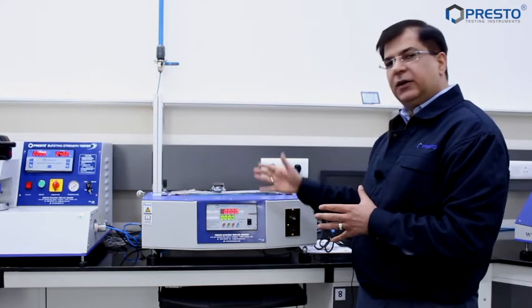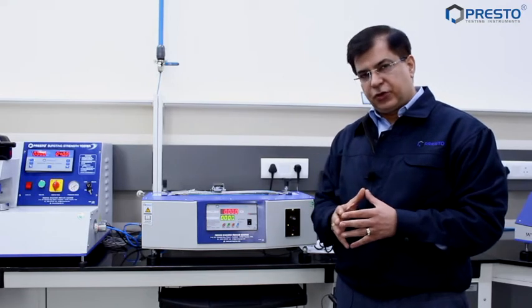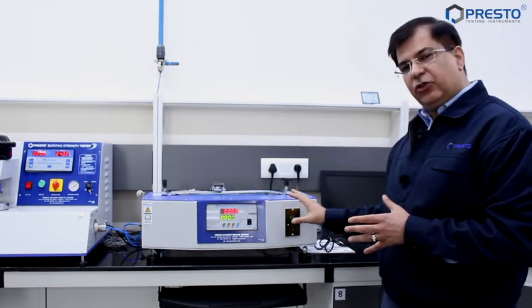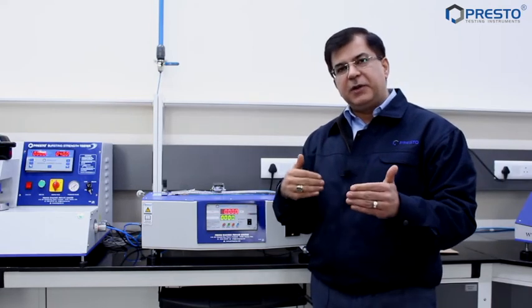We have the indicator and the drive. Always, whenever you do your coefficient of friction test, make sure you know at what speed you're checking. We have a drive installed here which will help you set the right speed.